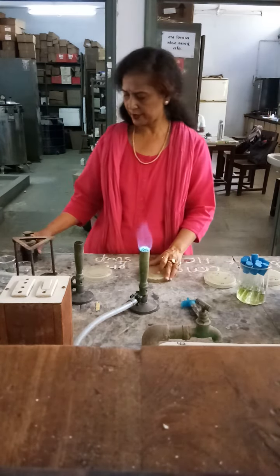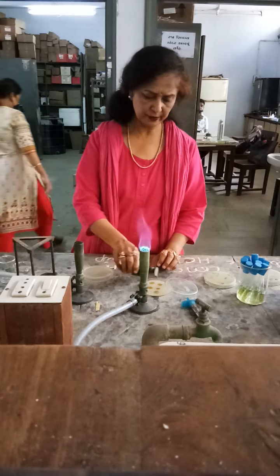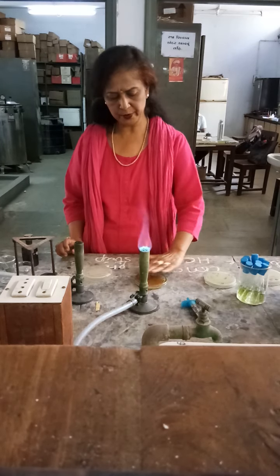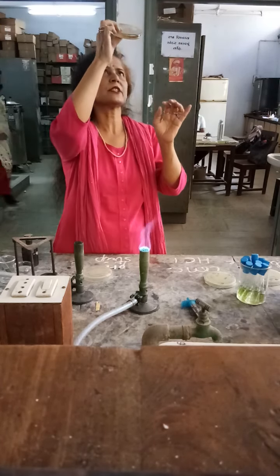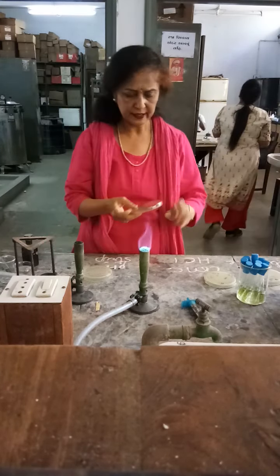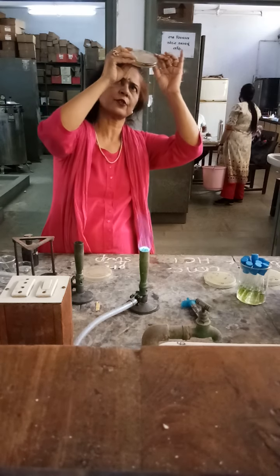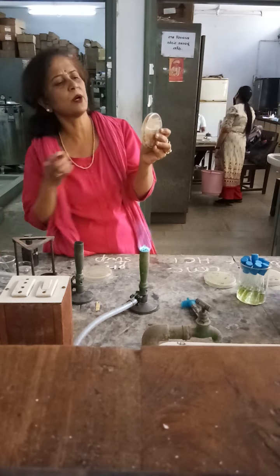Now in the case of the starch agar plate, we will try to identify the end products. We will add a little amount of iodine and then shake it properly to see the formation of blue colour in the plate. Because there are so many starch-degrading bacteria inside the soil, we will see certain zones which give a clear area. This clear area indicates there is no presence of starch at all, meaning the starch has been degraded. You can see very clearly that clear zones are formed around the colonies which have produced amylase.